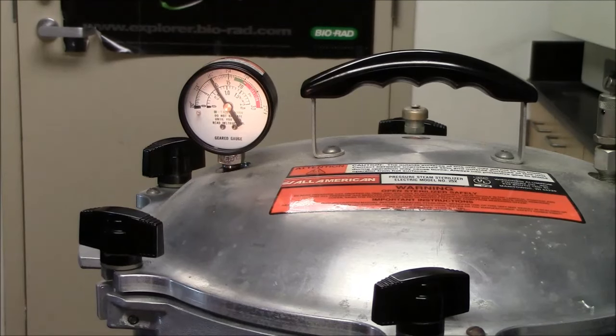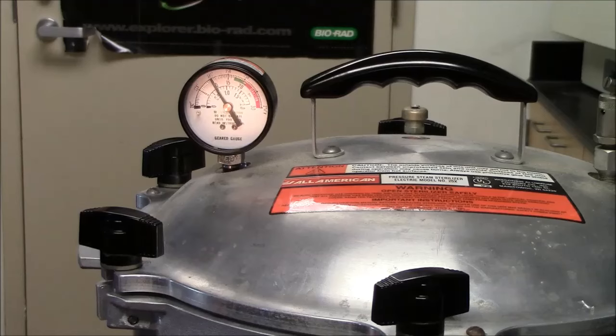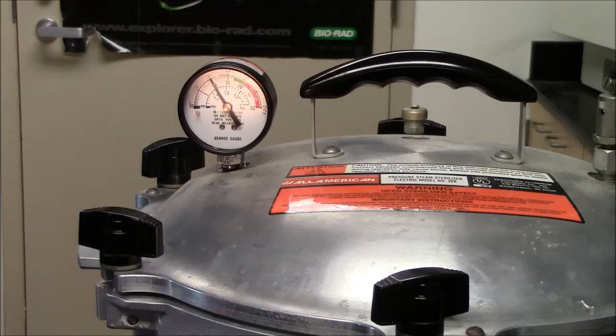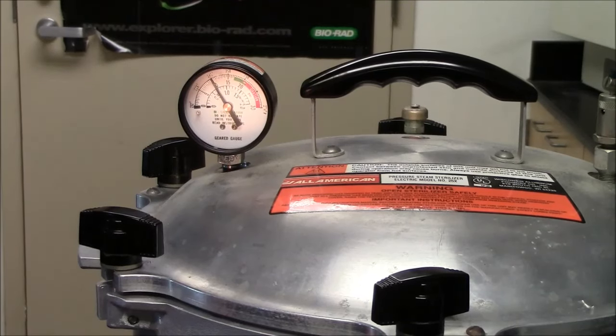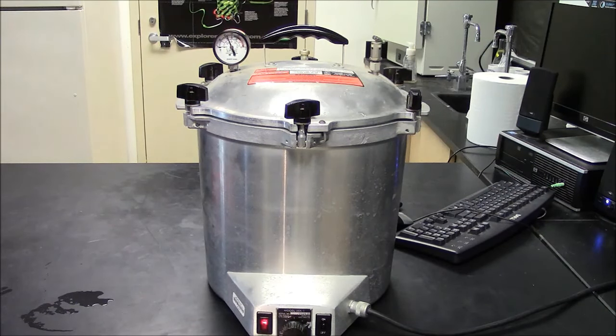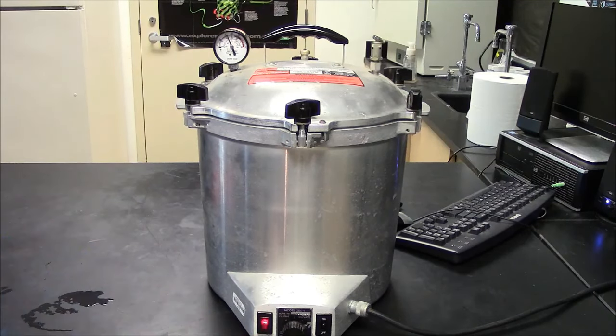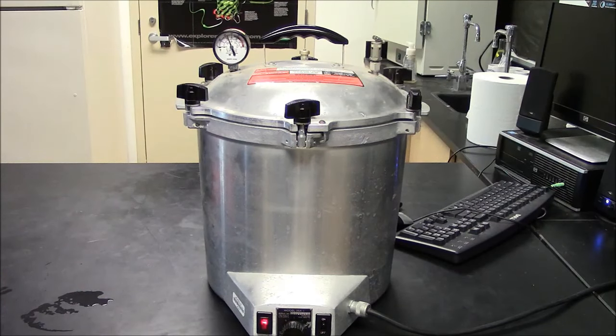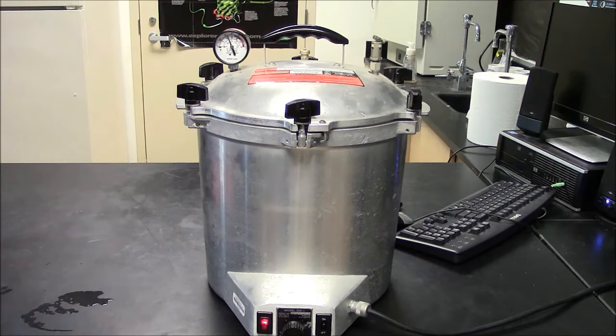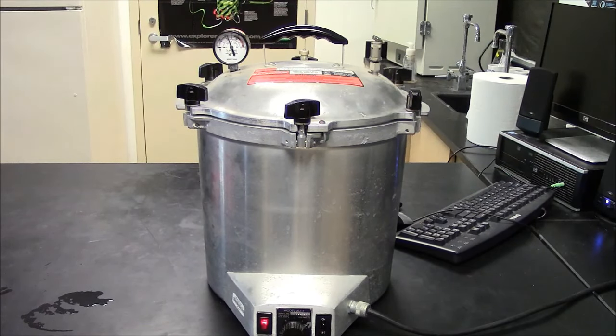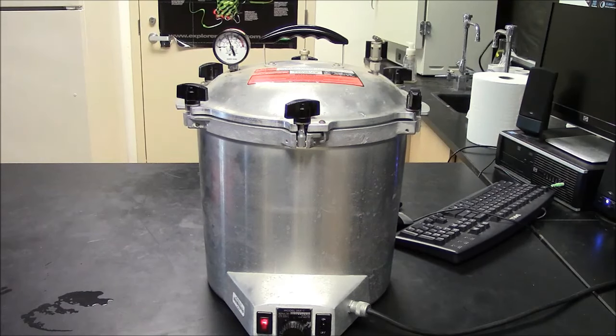It's been eight minutes since I closed the valve, and we're about halfway to the green zone now. I'm hoping another ten minutes will get us there. Here you can see I'm not close to the green zone. I was a little closer a couple minutes ago, but the thermostat down here turned off the heating coil. So I moved the dial a little bit, so that we can get back to the green zone. Notice the heating coil is on. So this is where I have to watch it and babysit it and make sure it stays hot enough, but not too hot.